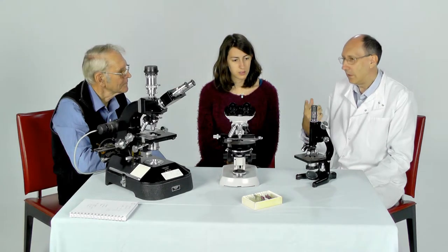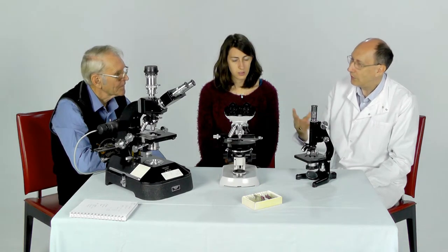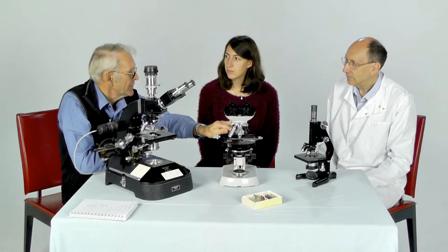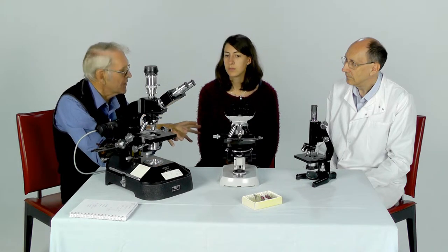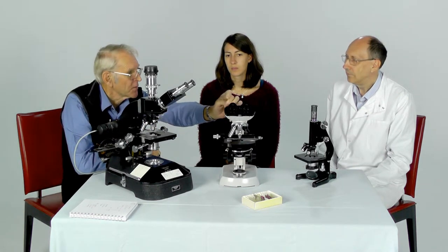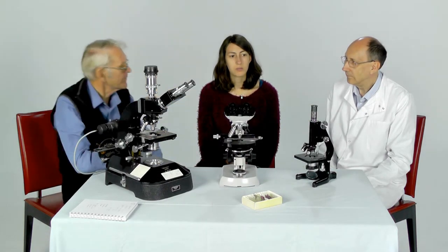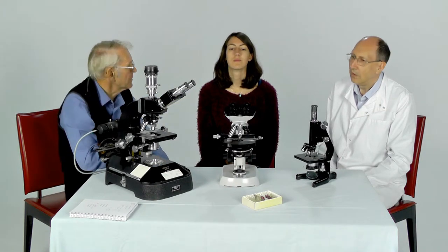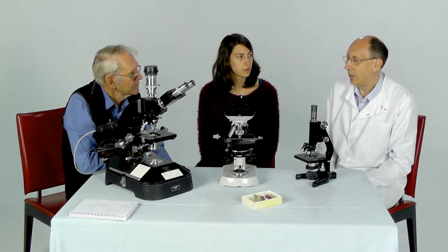Coming back to the objectives and the eyepieces — which are the more important in terms of optics and magnification? The objective lens is really the more important of the two, in the sense that it actually extracts the detail you want to see in your object, magnifies it to a certain extent, and creates what's called the primary image, situated just below the eyepiece in the tube. The eyepiece then looks at that and modifies it ready for reception by your eyes. So the quality and resolution of the image is really determined primarily by the objective.